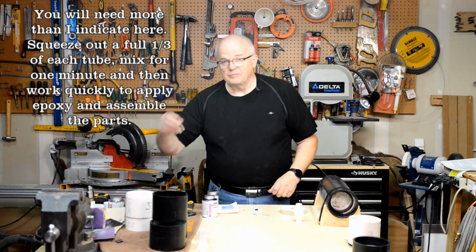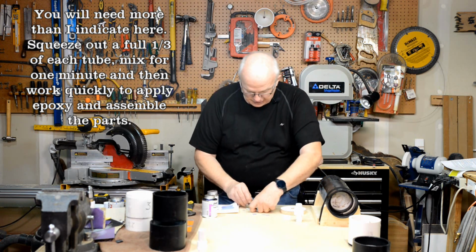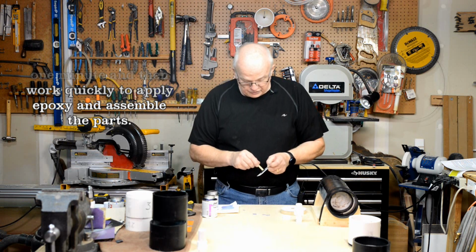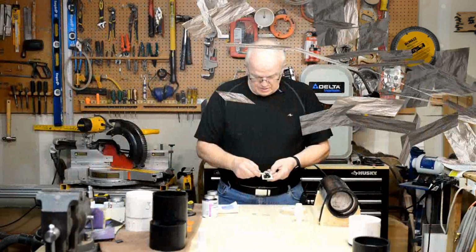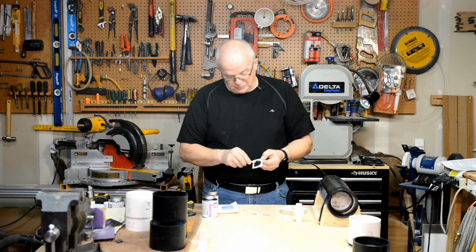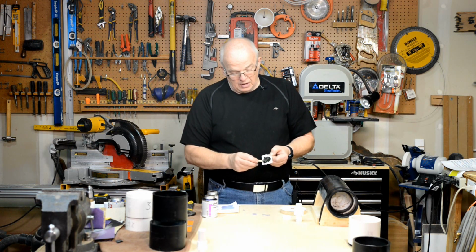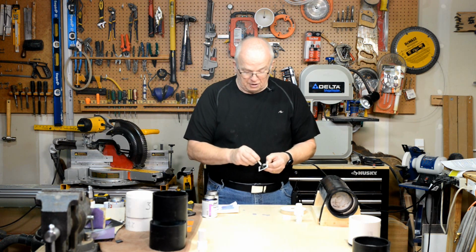I have another piece of my chopstick here, and I'll start to mix that around. Okay, I'll show you right here. There's not very much. You're not going to need much for this, but you are going to have to mix it for about a minute. You want this well mixed. Okay, that's been about a minute. Now, while I paused there, I did add some more to it. I didn't have enough. You need a fairly good glob of this.